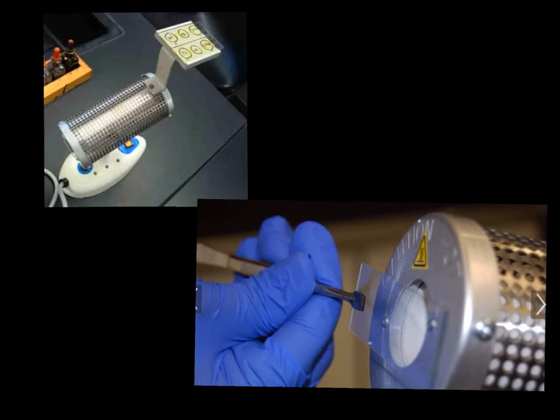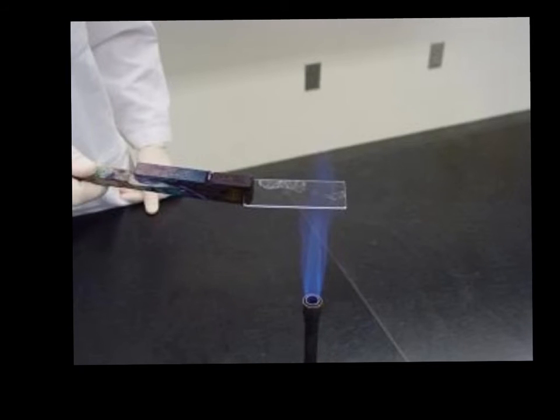If we do not have that, we can use a Bunsen burner. If our procedure requires using a Bunsen burner to heat fix the bacteria, we're going to hold the slide by one edge and pass it slowly through the Bunsen burner once, twice.